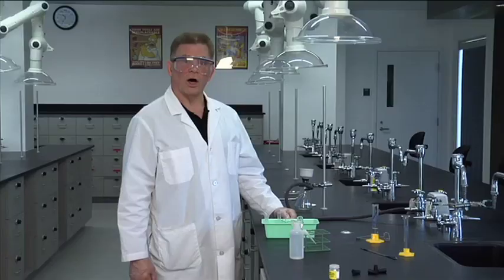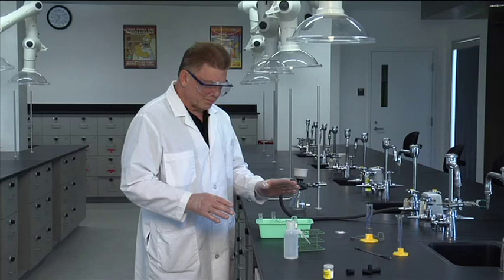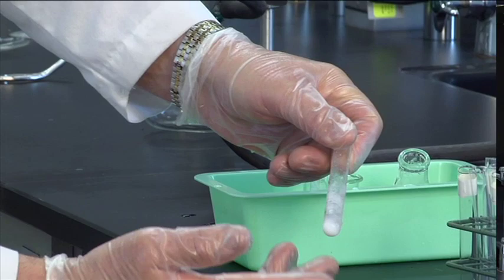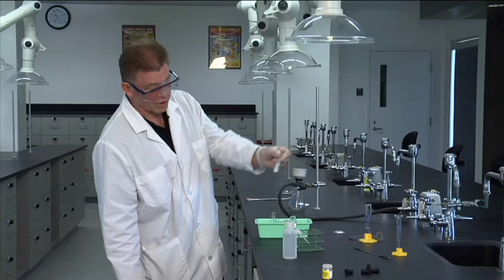Now we're going to revisit our benzoic acid. You know what? Before, I'm going to give that a couple more minutes. Let's see what happened in our test tubes. Here was the benzoic acid in water and as I flick that around, I think you can see the water is still liquid and we've got a lot of crystals in there. So that looks good.